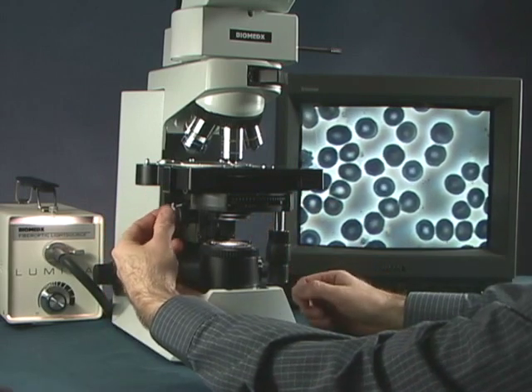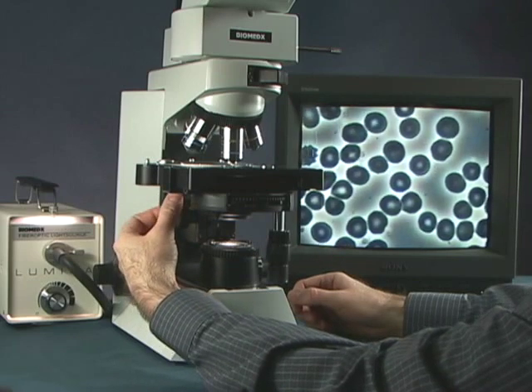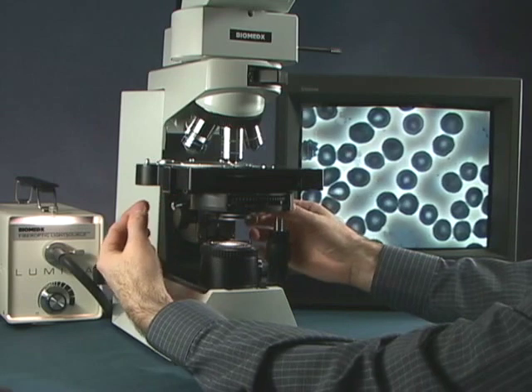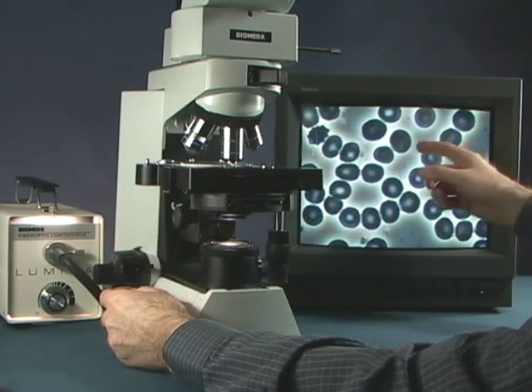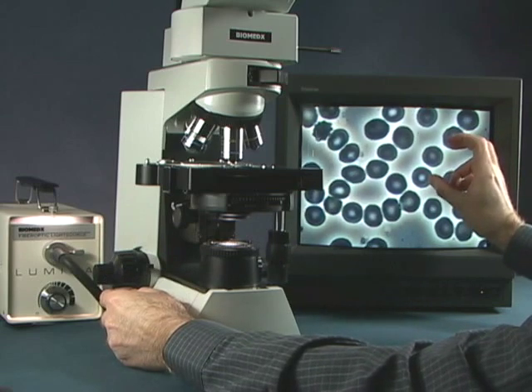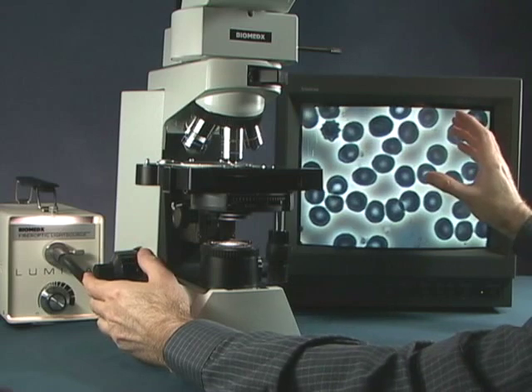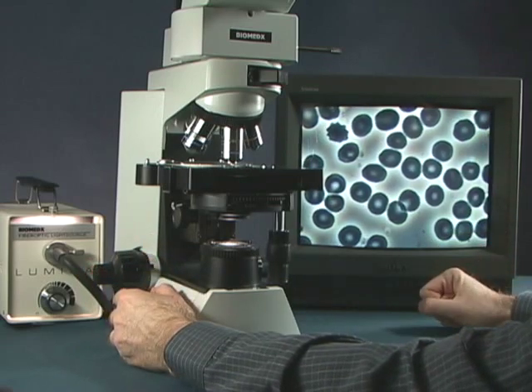Then you go to the other side, push it in and go one way and the other. And then what you are wanting is a nice ring around the red blood cells evenly all the way around and you want that good contrast to be jumping out at you.